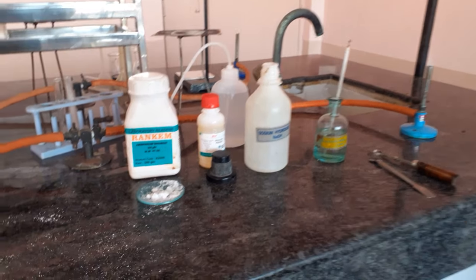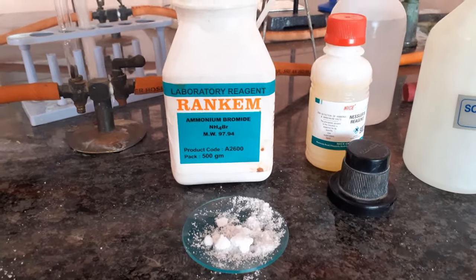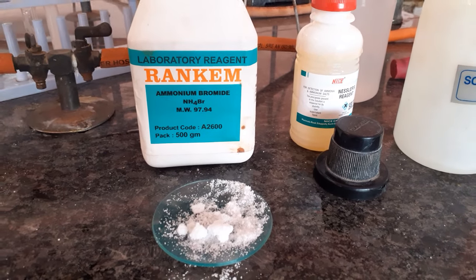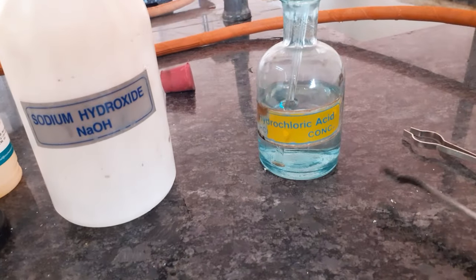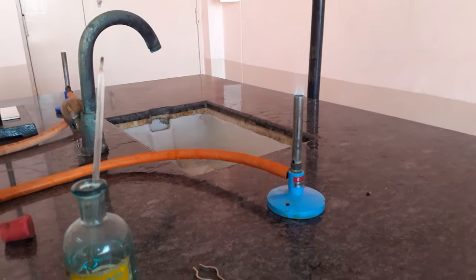Good morning, class 11th and 12th. We are beginning with the cation analysis and we will be doing the zero group cation, which is ammonium, which we are going to test today. It's a white salt and the requirements are Nessler's reagent, sodium hydroxide, concentrated HCl, and you might require a burner since it is cold.